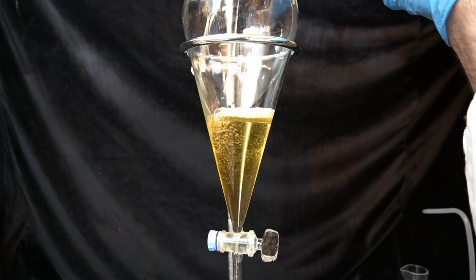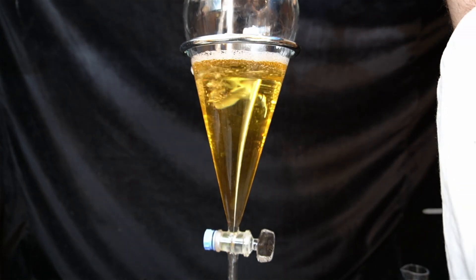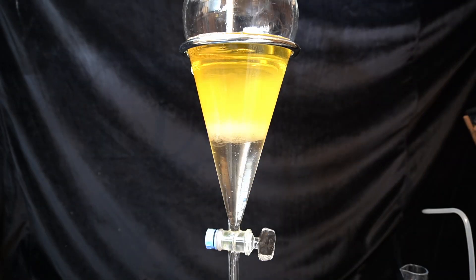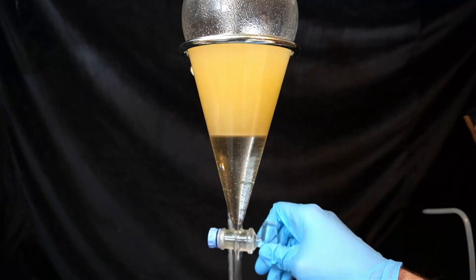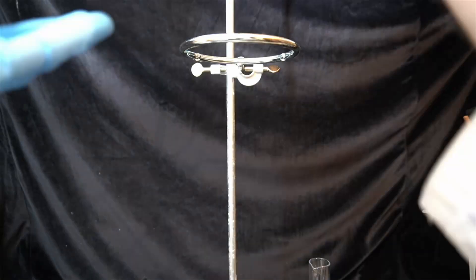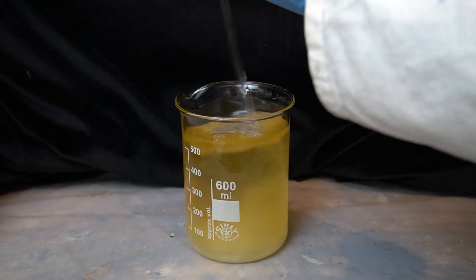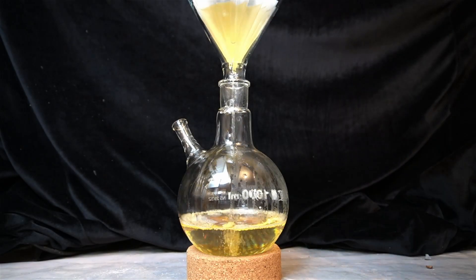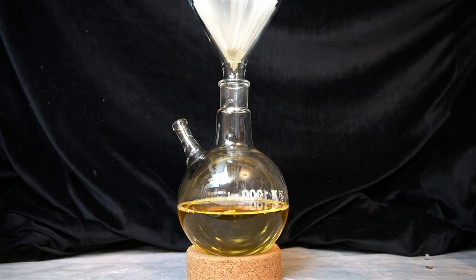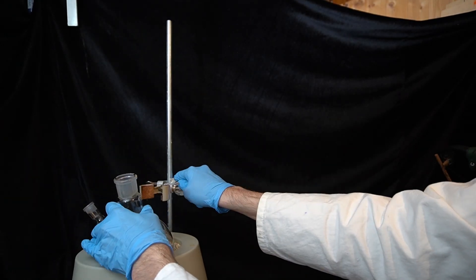I transfer the organic phase to a large separatory funnel, add all of the water from the trap, and wash it twice with a saturated sodium bicarbonate solution, then a few times with distilled water, and one last time with saturated sodium chloride solution. I then dry the organic phase with magnesium sulfate and transfer it to a 1-liter round bottom flask. All that's left to do now is separate the toluene from the product via distillation.